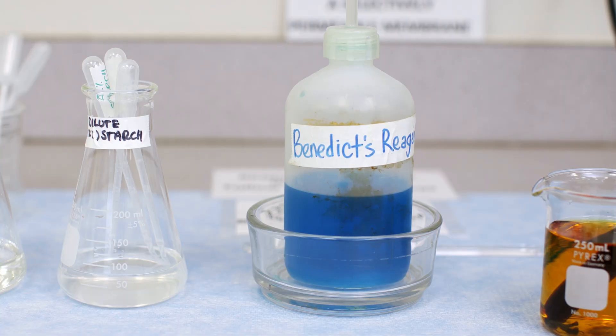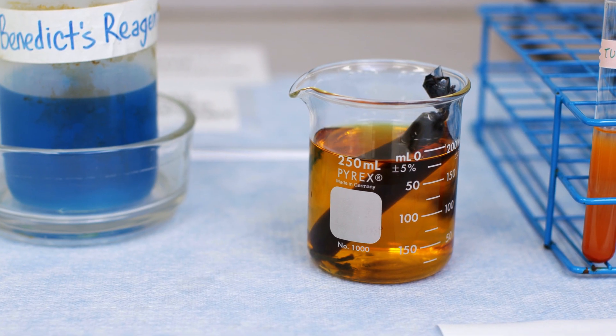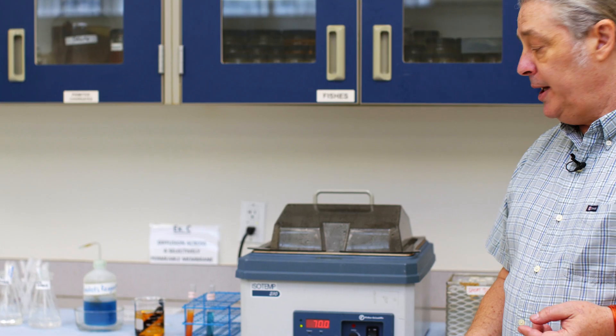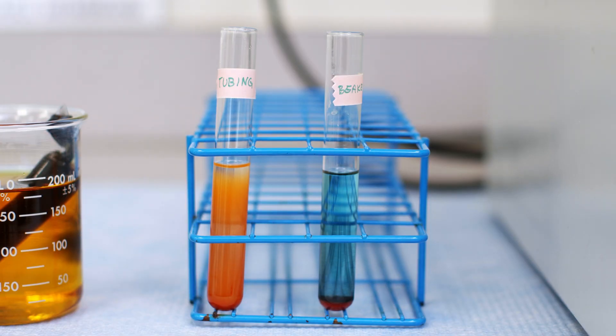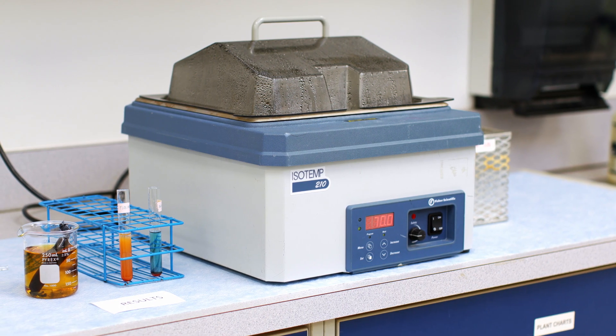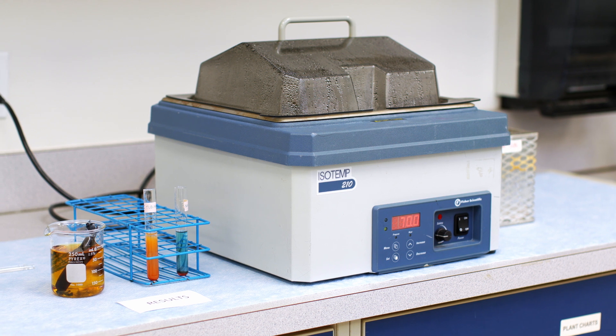Then we want to test to see if anything has come out of the tube from the solutions we put in. We can test with Benedict's reagent to see if any of the glucose molecules placed inside the tube have made their way out into the iodine solution in the beaker. We'll take a little bit of that beaker solution and place it in a test tube with Benedict's reagent, incubate it, and then see if we get a result.